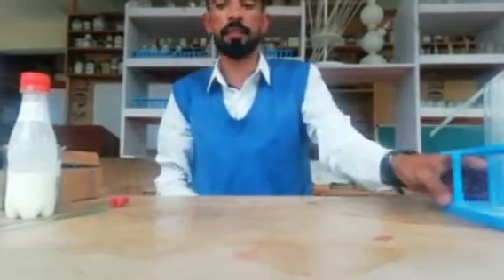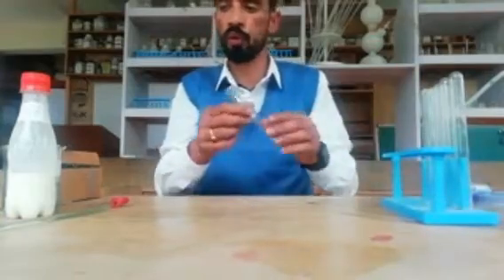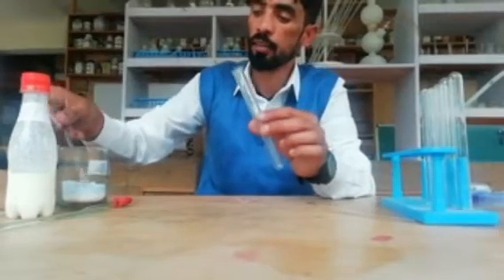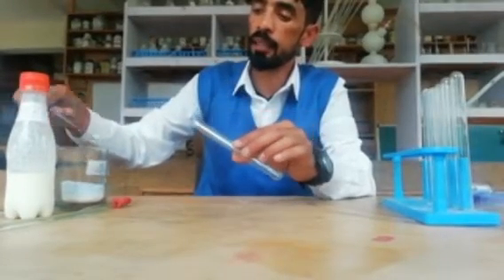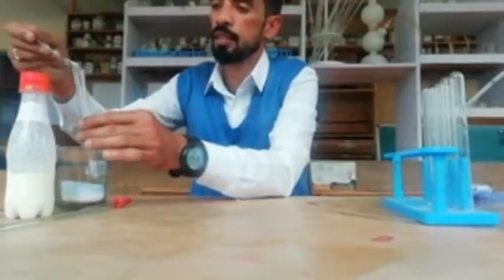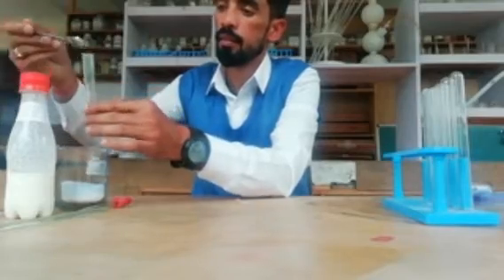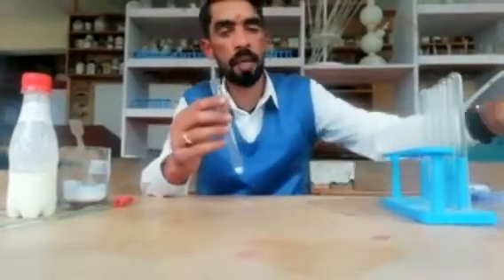Without wasting any time, let's start. First I am taking the first sample — I am making the solution of washing soda. While I make this sample, just think: what is washing soda basically? Is it acid or base?